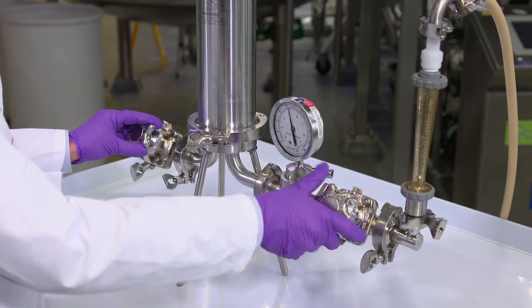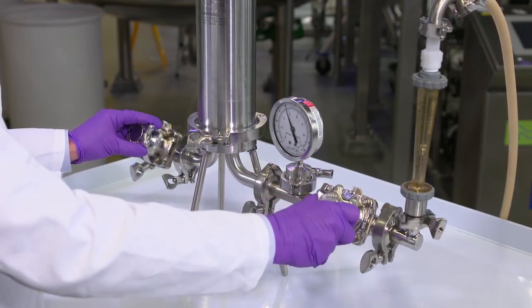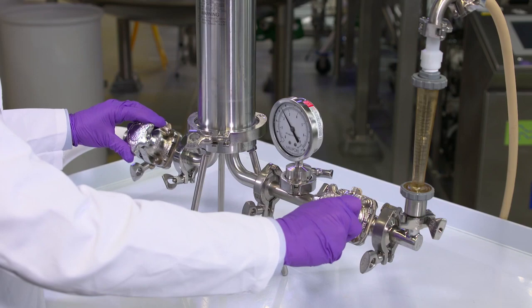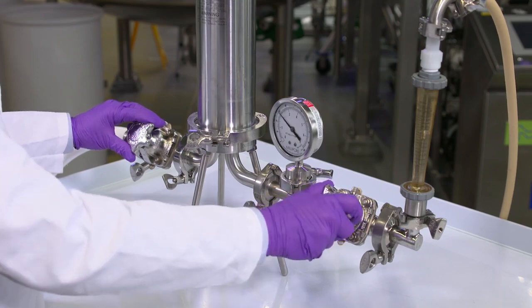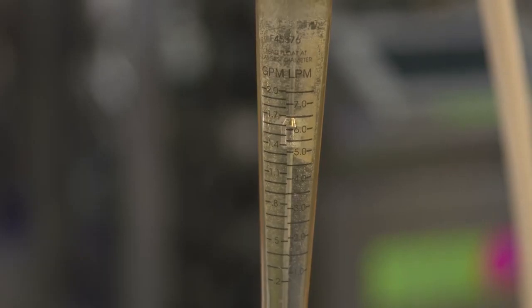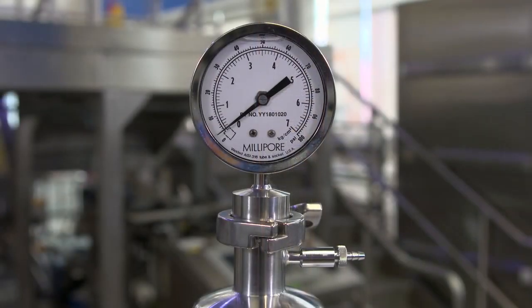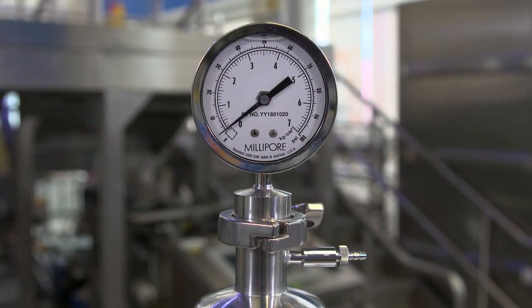After one minute, open the outlet valve and adjust the flow to the recommended minimum of one liter per minute per 0.1 square meters of filter area. A flow meter is a good way to monitor the flow. If a flow meter is not available, monitor the differential pressure.